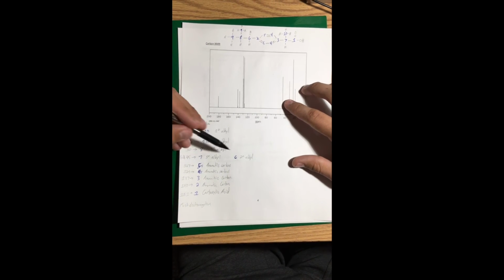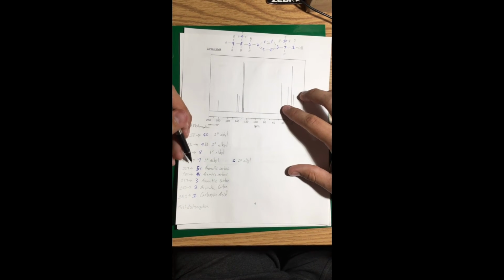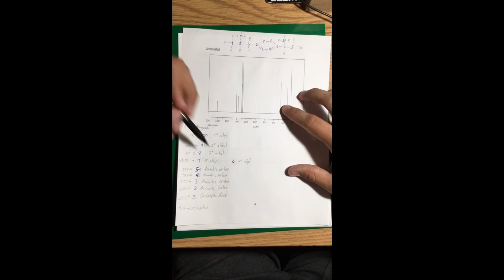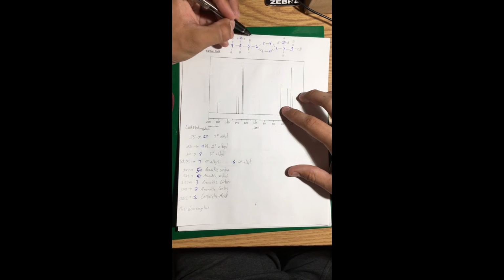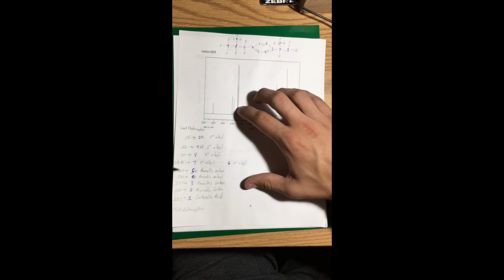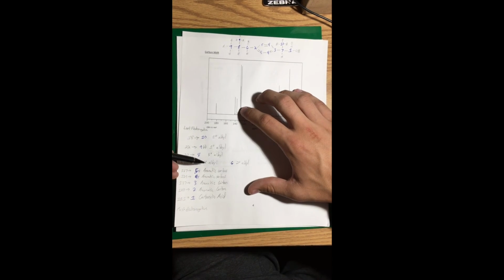Next, move into 45, which actually has 2 of them on here. Represents a tertiary alkyl and a secondary alkyl. 7 is the tertiary alkyl, right here, attached to 3 different carbons. And then 6 is secondary alkyl, attached to 2 different carbons and 2 hydrogens. And the next 4 numbers, 127, 129, 137, and 140, all represent an aromatic carbon.